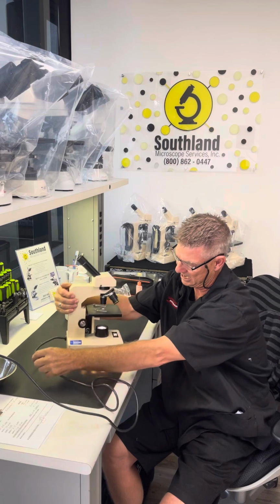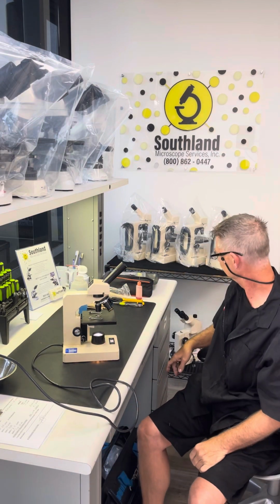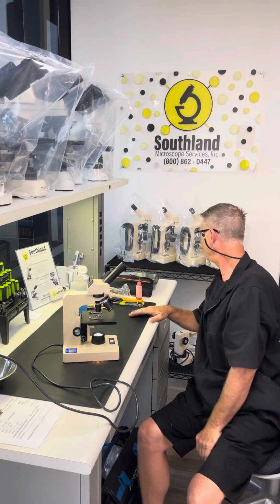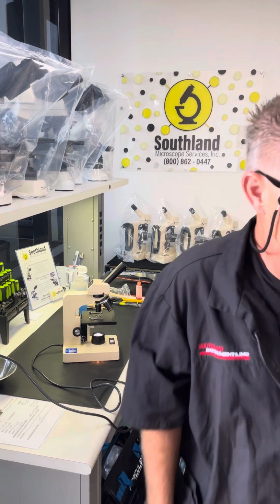What I want to do next is I want to see how well the microscope works. I need a slide. That's going to kill my video.